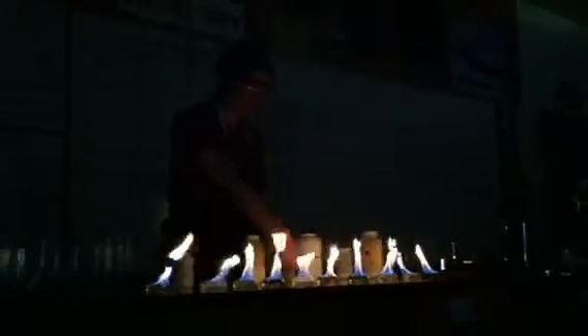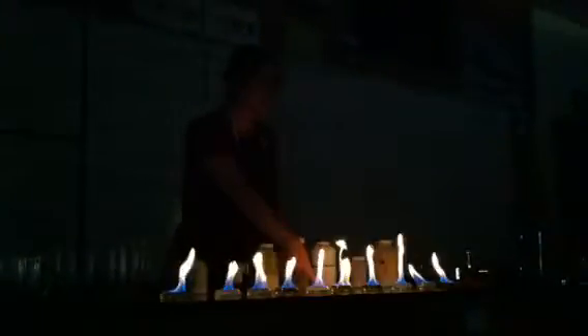We can start to see some very clear sparkles. What are some practical examples we talked about? Fireworks. I love fireworks.